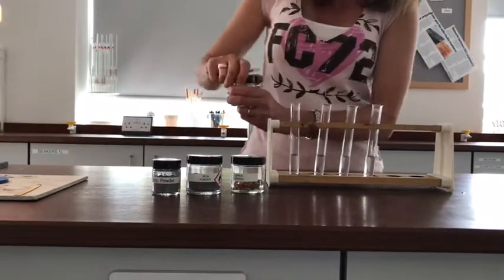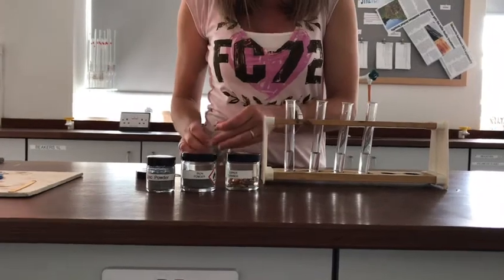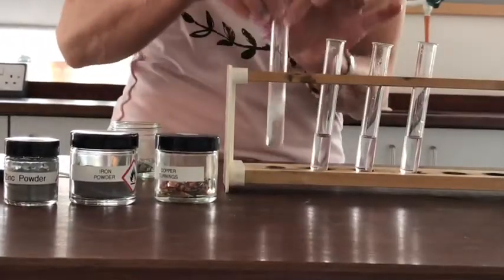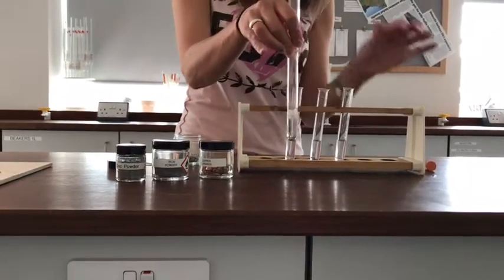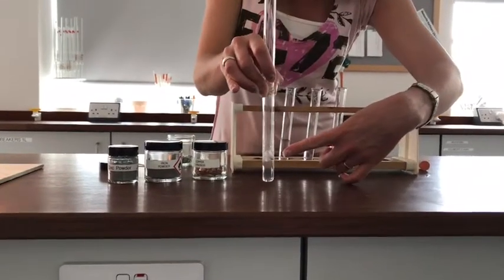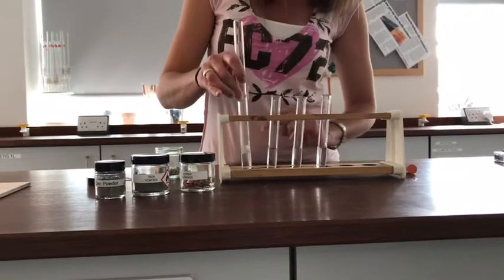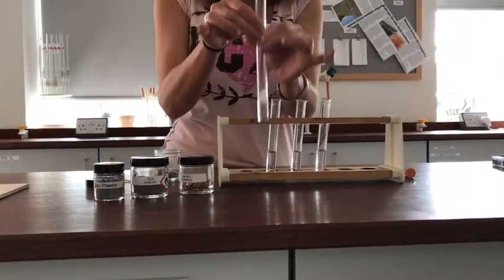I'm going to put some of that metal into each tube and see if we get any bubbles coming off. Magnesium in the first one — that's bubbling like mad. So I'm going to put a tube there ready to collect any gas coming off from that. Assuming it's hydrogen, I know hydrogen is less dense than air, so the hydrogen should work its way all the way up into this top tube and get stuck at the top, because this one's upside down so it can't get out. I'll carry on collecting that and come back in a minute when it's finished reacting.